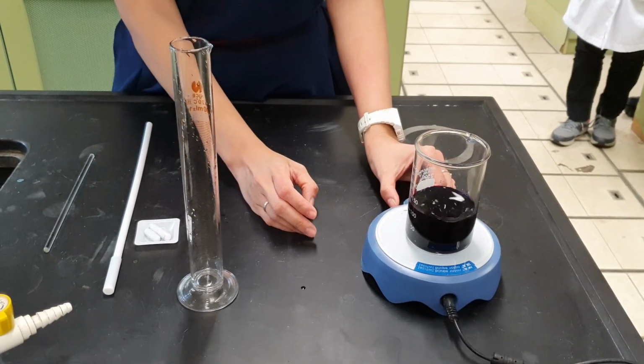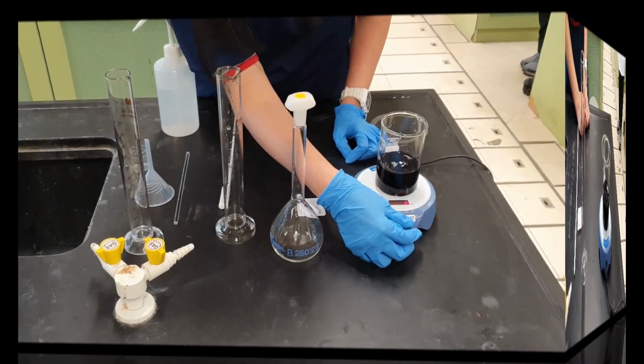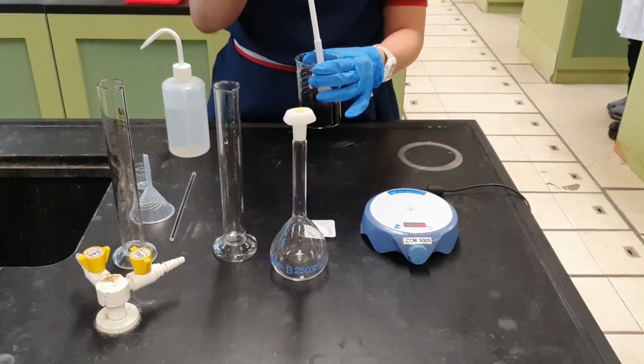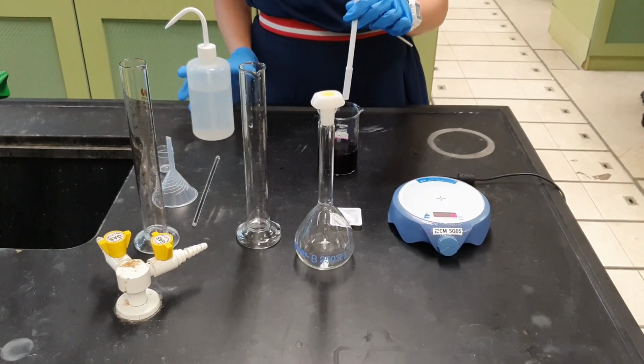There should be a vortex seen during mixing for effective mixing. After mixing, switch off the magnetic stirrer. Use a magnetic stirrer bar retriever, remove the magnetic bar from the solution. Rinse the retriever and the magnetic stirrer bar with distilled water.